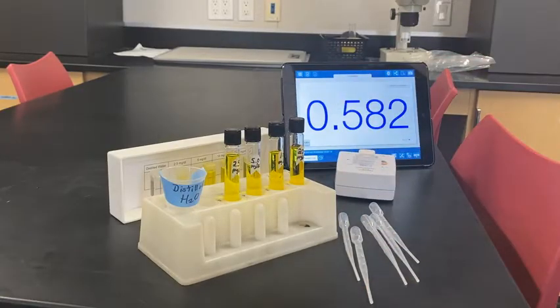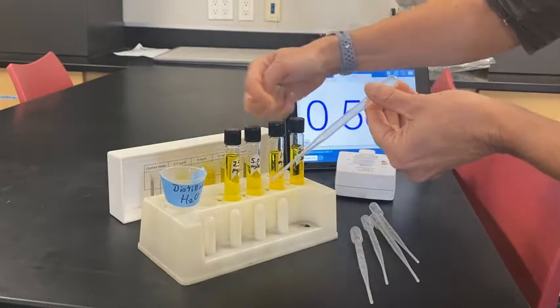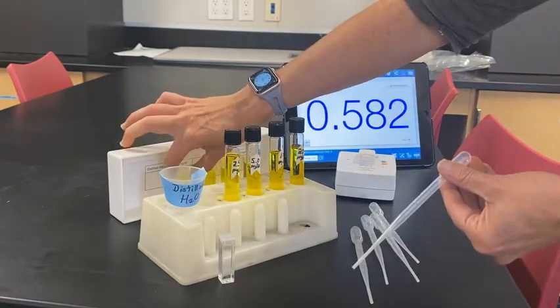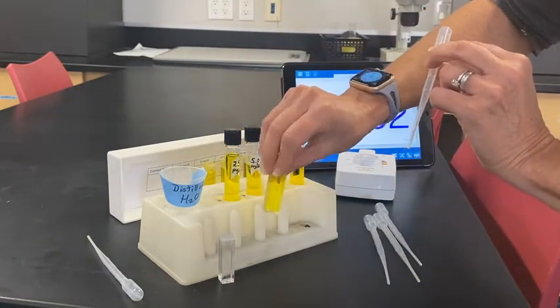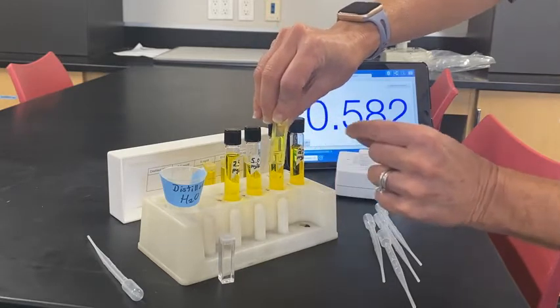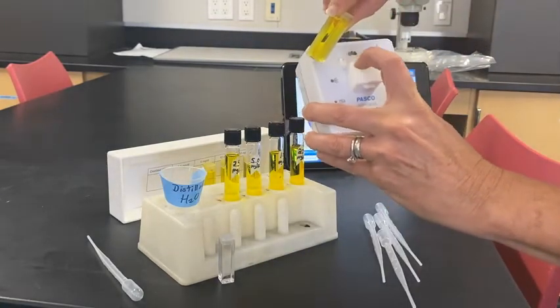This is what your setup looks like. You need distilled water and all the knowns, and then make sure you transfer from the stock bottles to these little containers called cuvettes. Here is a cuvette filled with distilled water, and you will use a different pipette. Here is a cuvette with the bilirubin serum. Notice there is a ribbed side and a smooth side on some cuvettes.